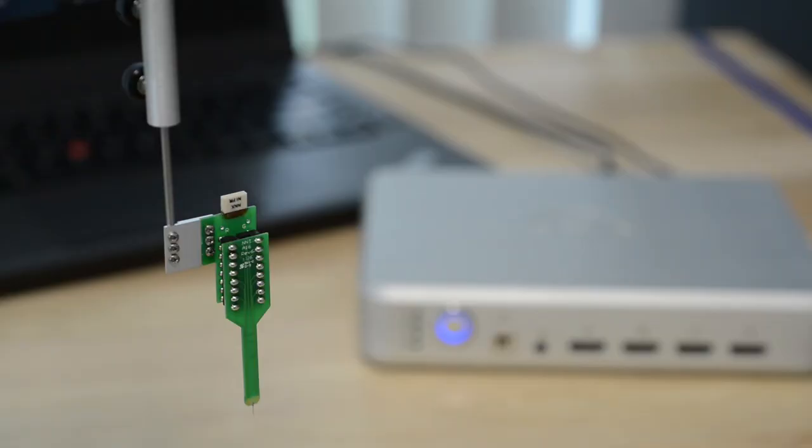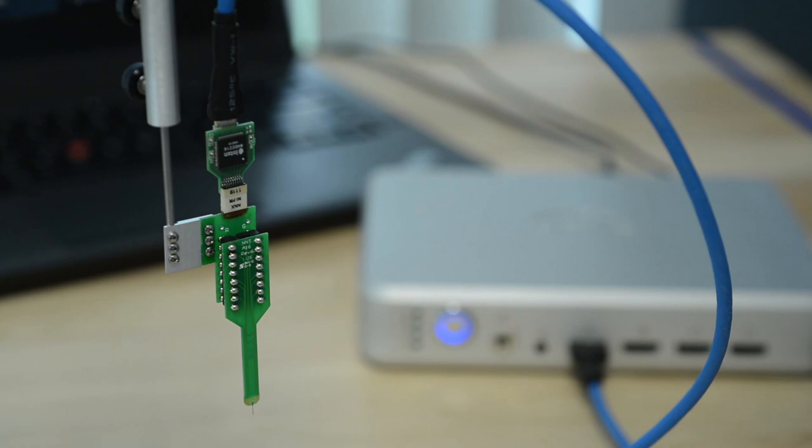Connect both micro and macro electrodes to the SmartBox. Conventional high-impedance probes, such as Neuronexus standard probes, can interface with the SmartBox via SmartLink headstages.